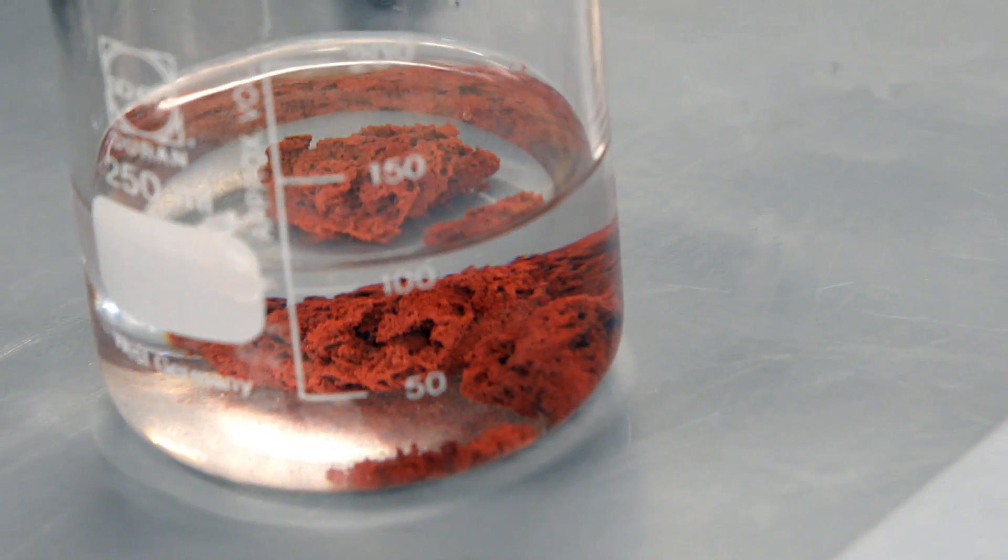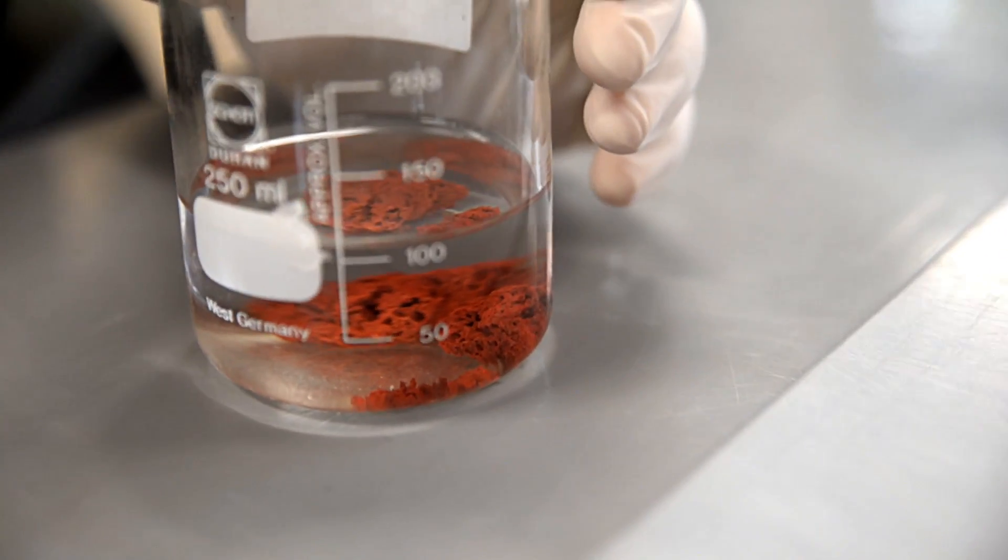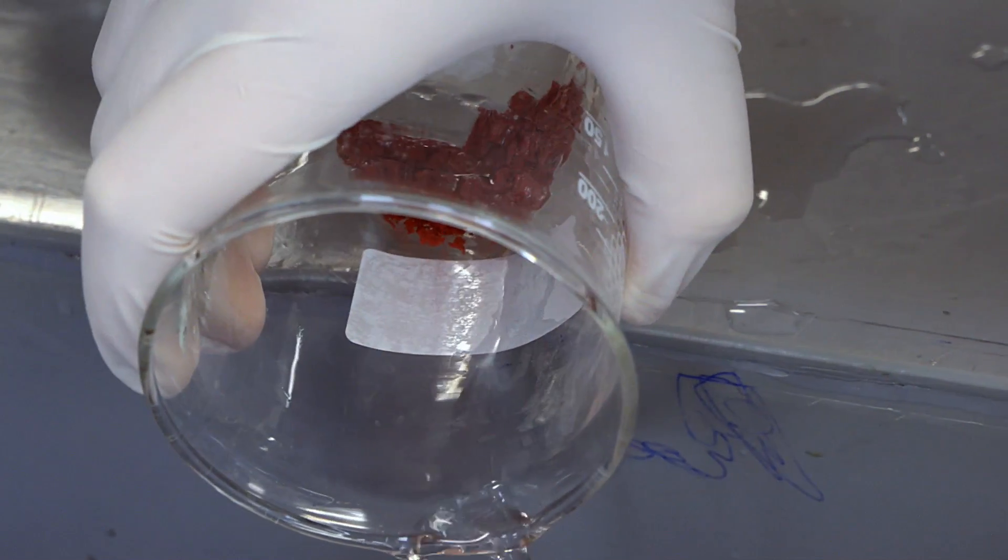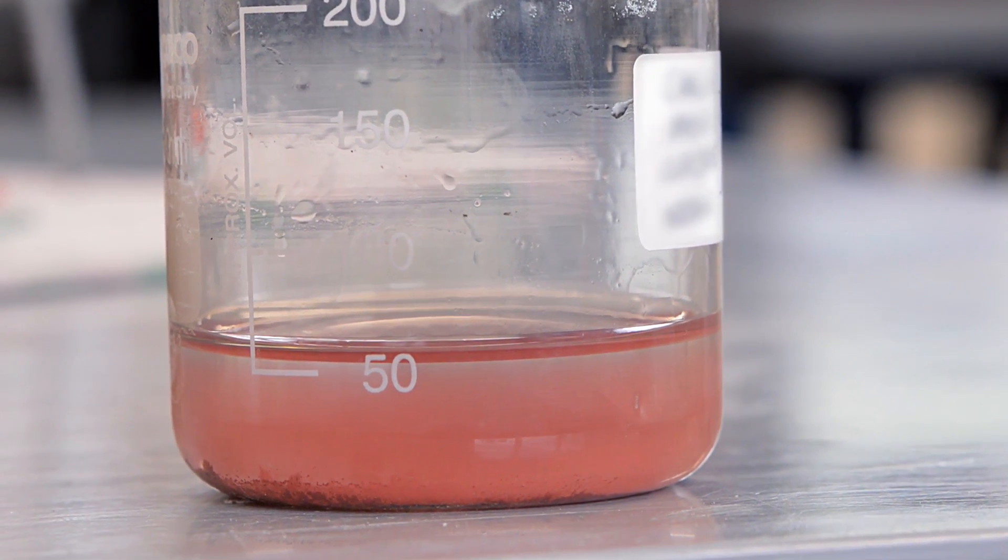The next day we found that the color from the solution had disappeared and went clear. All that was left was a stringy brown substance. We decanted off the clear liquid and rinsed it just like we did before.